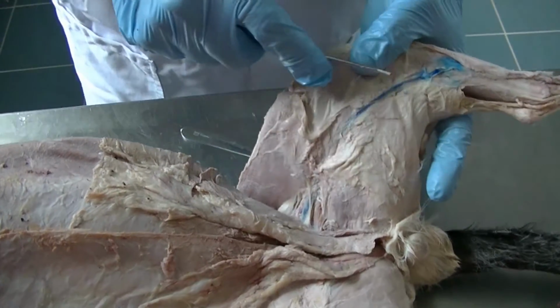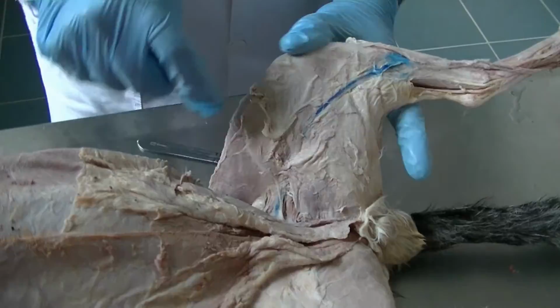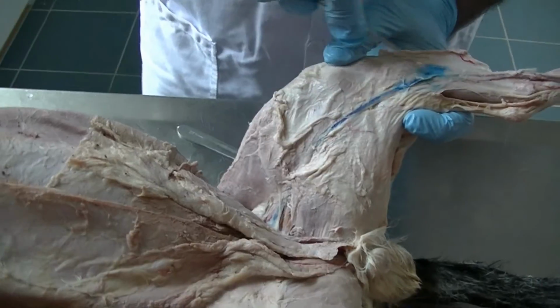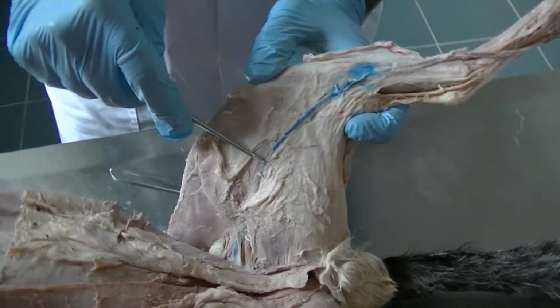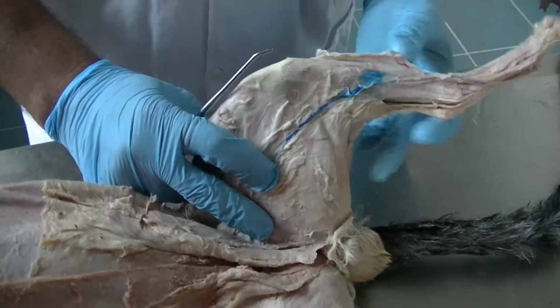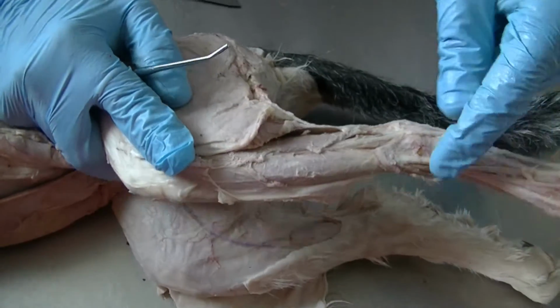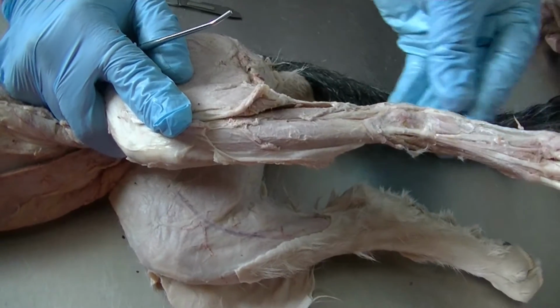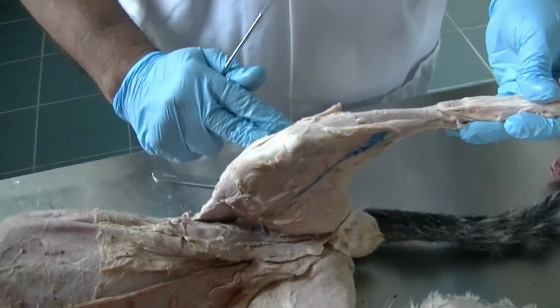The structure that we see here, apart from muscles, is the medial saphenous vein. In the dog, the medial saphenous vein is fairly small, while in the case of the cat, this is much larger than the lateral saphenous vein, and that is the one which is always used for intravenous injections if we prefer to use the hind limb rather than using the lateral saphenous vein. The lateral saphenous vein is still present. It would be in the same form as we see in the dog. Both of them would be anastomosing on the dorsal aspect of the tarsus and collecting blood from the dorsal and plantar aspect of the digit, bringing it back to the femoral veins, as both of them go on both sides. Okay.